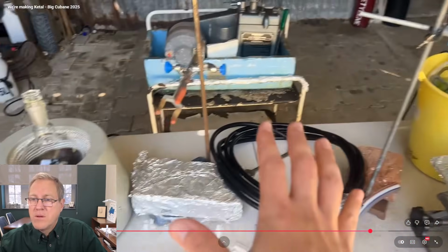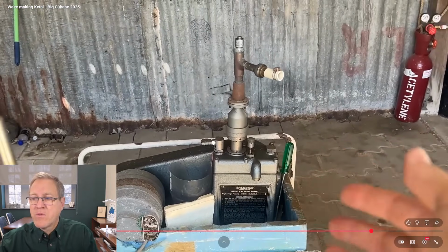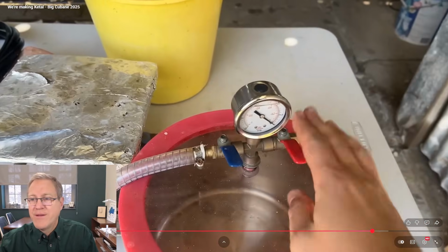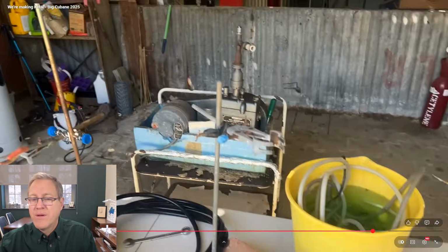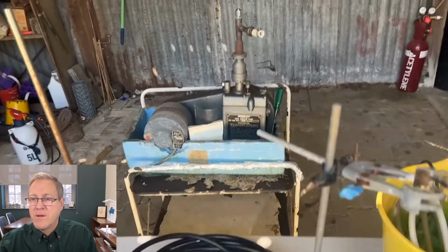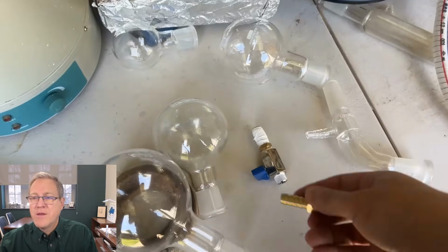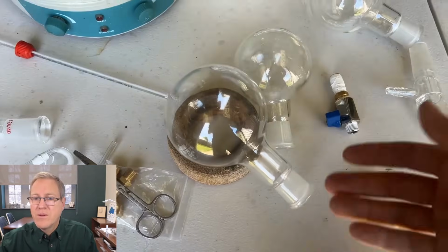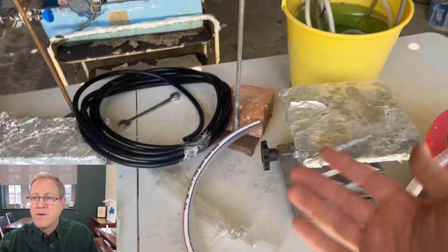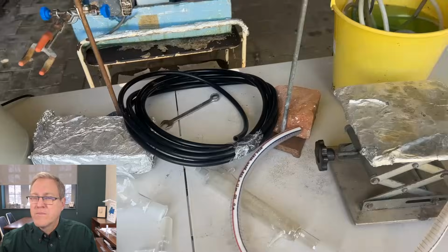Last time we ran it and we got it working, we used this pump here, which is a good pump, but not really what should be used for this kind of thing. And we ran the vacuum through this to use as a vacuum gauge just because that's kind of what I had on hand. But this time, we're going to do the same thing. It worked. I got slightly better tubing. I bought some MPT fittings and some of them have arrived. I had a better gauge, but I don't have the adapters for it. They didn't arrive. I still want to do the science, so we're just going to be running it through this again. Maybe a slightly better cold trap, better tubing, and we'll see how we go.